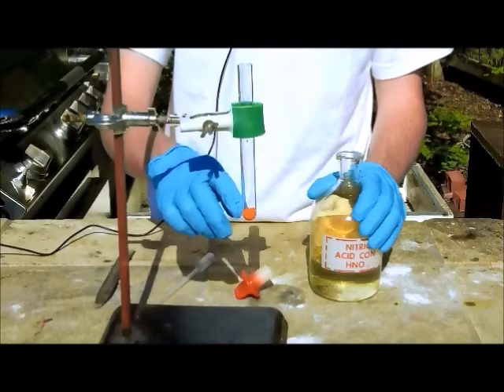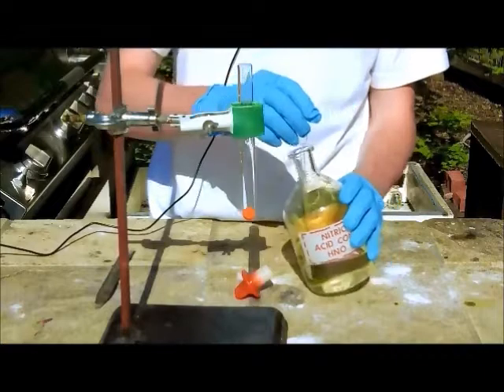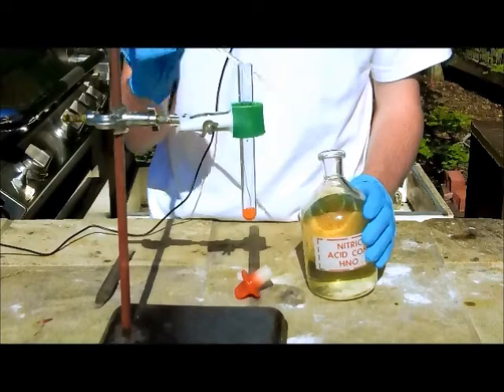In the test tube I have potassium dichromate, which is this orange powder. To it I'm going to be adding a few milliliters of concentrated nitric acid. Do this very carefully.